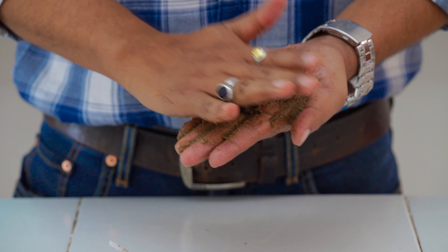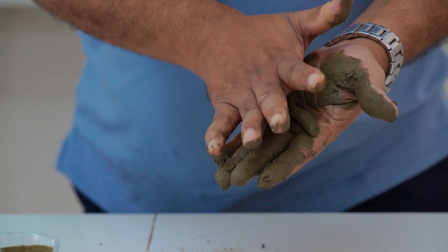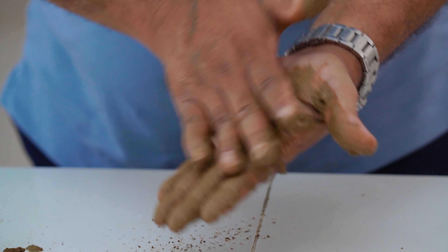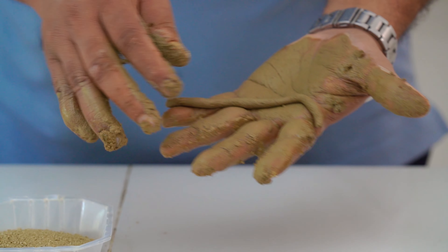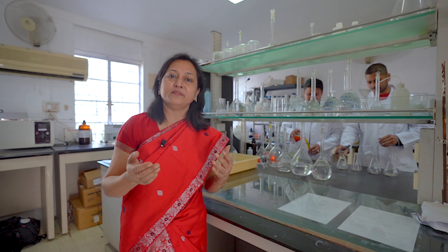Try to form a ribbon. Does not form ribbon: loamy sand, sandy loam, and loam. Slight ribbon forms with flaky surface: silt loam. On squeezing, ribbon forms with some flakes: silty clay loam. On squeezing, forms long ribbon: clay.